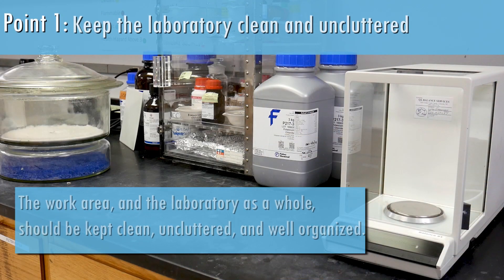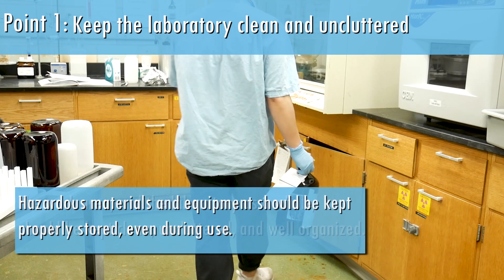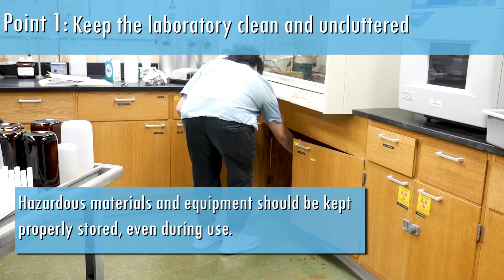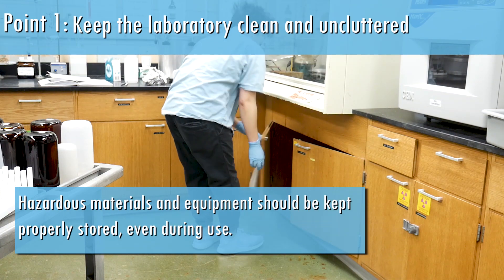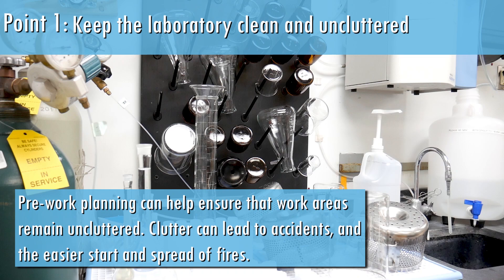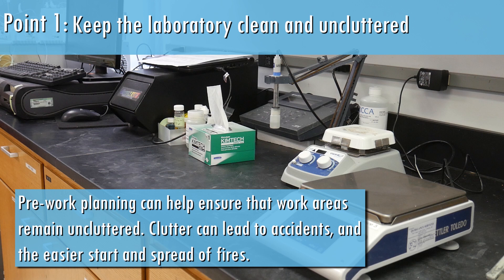The work area and the laboratory as a whole should be kept clean, uncluttered, and well organized. Hazardous materials and equipment should be kept properly stored, even during use. Pre-work planning can help ensure that the work areas remain uncluttered. Clutter can lead to accidents and the easier start and spread of fires.